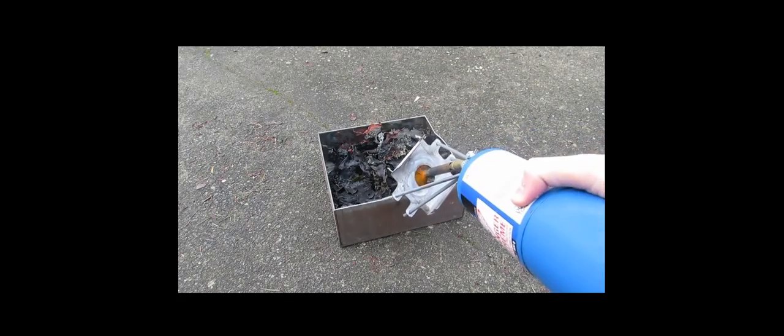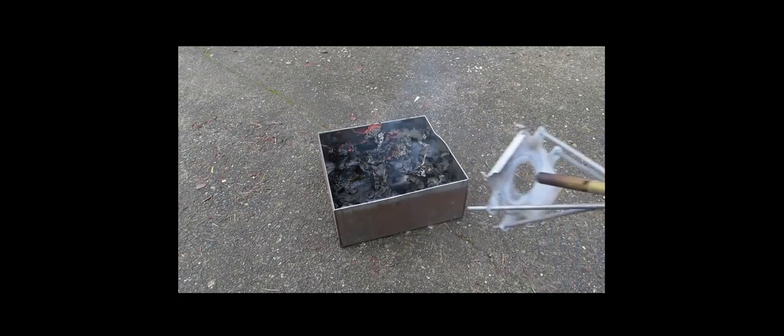So the first thing that we're going to need to do is to burn this down into ashes. So let's see if we can set this stuff on fire. I'll be back if I figure a way to light this. It seems to be pretty difficult to light.